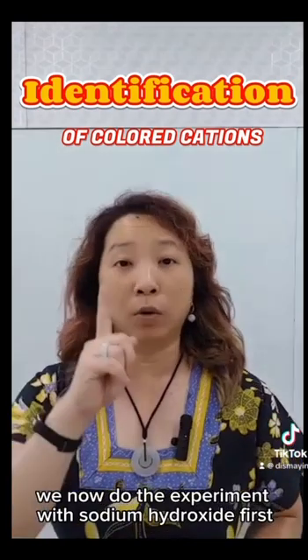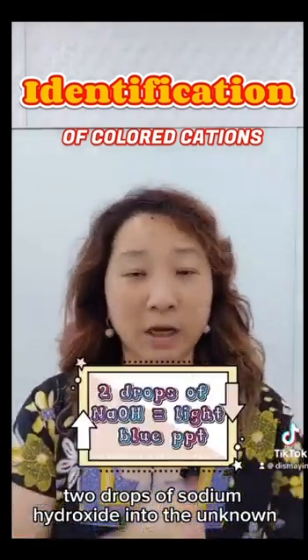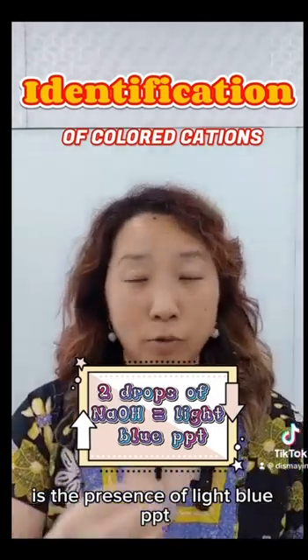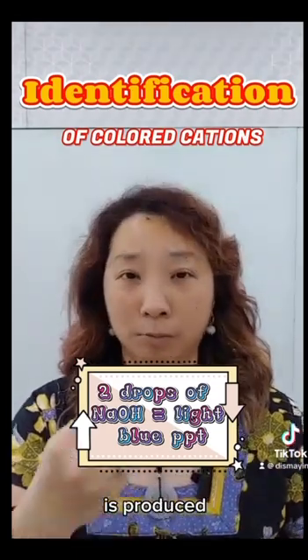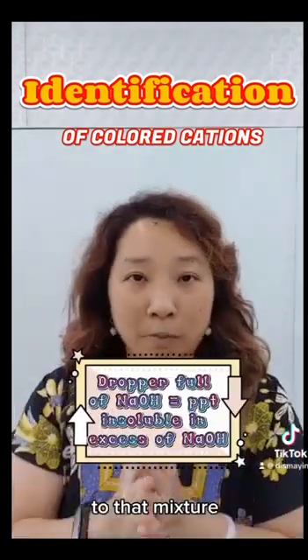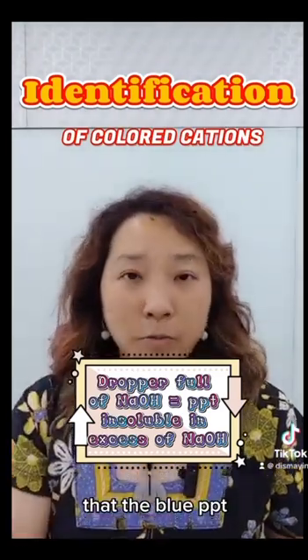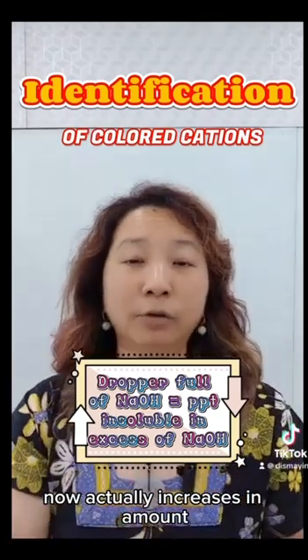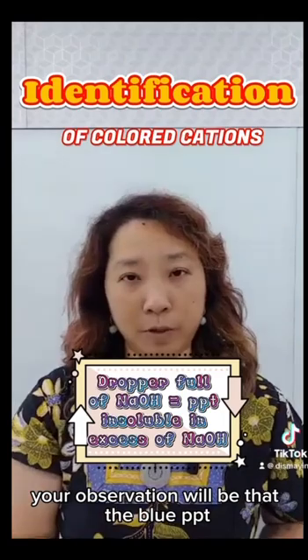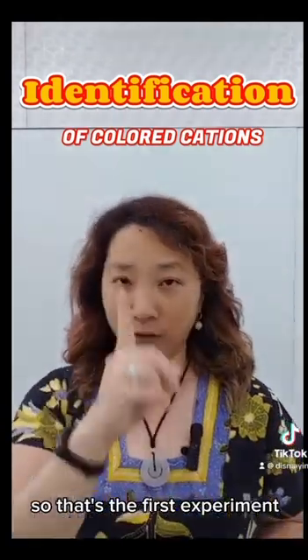What do we do? We now do the experiment with sodium hydroxide first. 2 drops of sodium hydroxide into the unknown. What you should observe is light blue PPT is produced. Then you drop in the whole dropper full, in excess this time, to that mixture, and what you should see is, for sodium hydroxide, that the blue PPT now actually increases in amount and remains in the test tube. Your observation will be that the blue PPT is insoluble in excess of sodium hydroxide.